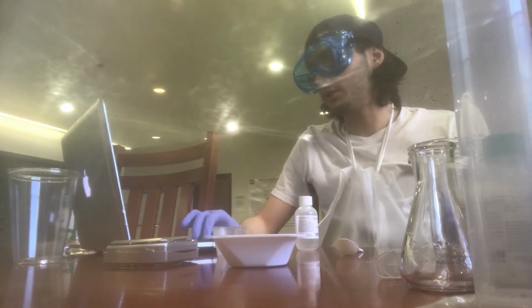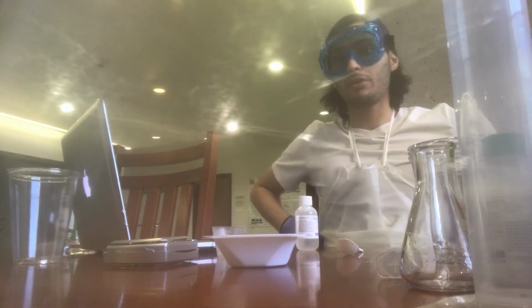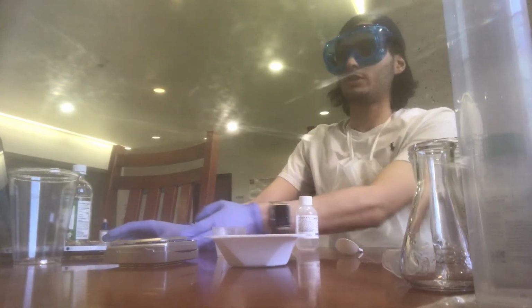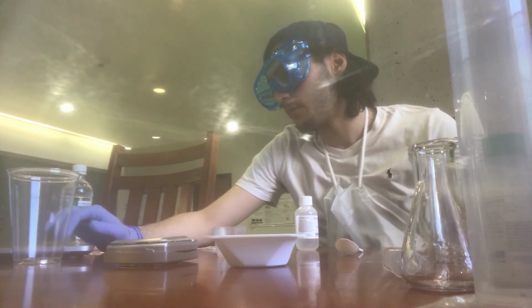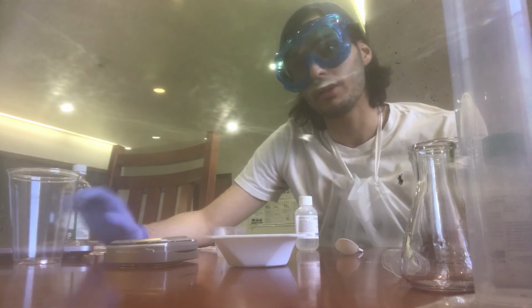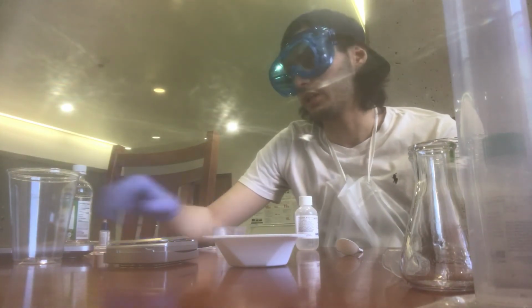So let's go ahead and jump into the experiment. I'm wearing my safety gear. I have my gloves on, my goggles on, and my apron on, and the whole table was disinfected, and I have my electronics pushed away when I start the experiment. As I said before, doing a titration is very important because you don't want to add too much of the different solution, because whether it's 0.1 ml or half a ml, that could make a big difference in the whole experiment, and it could also alter your experiment results.